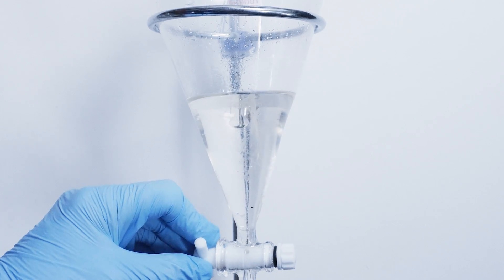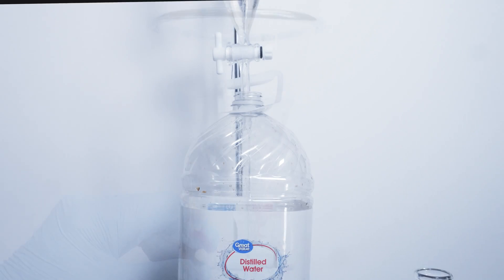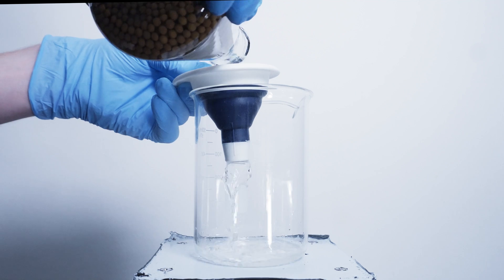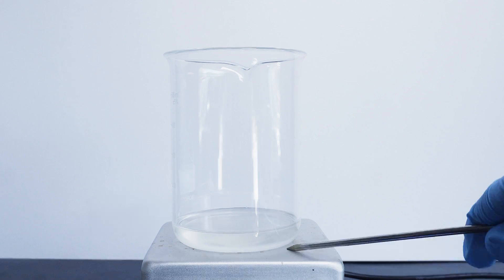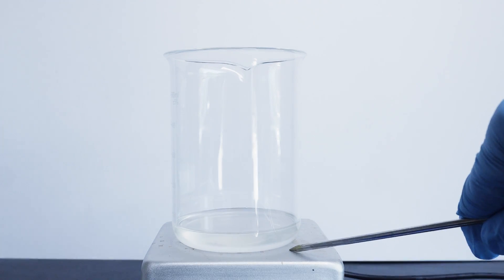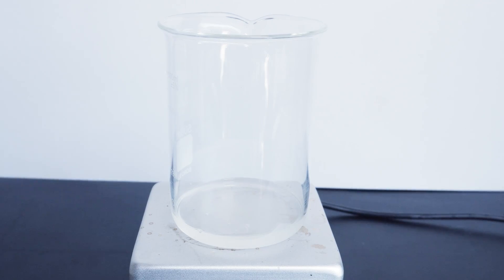This was really an amateur mistake but I decided to continue with the project and either redo it or just adjust my results up by 30%. I dispose of any leftover solution and filter off my DCM into a beaker. After this we just have to boil away the DCM at a low temperature to leave behind the caffeine. DCM boils at 103 degrees Fahrenheit so it really isn't hard to do. Alternatively I could have distilled off the DCM but with such a small amount of caffeine I would risk sublimating the caffeine in the process.